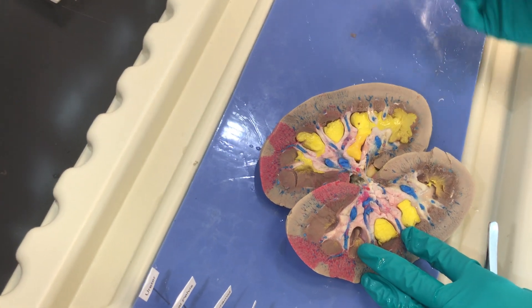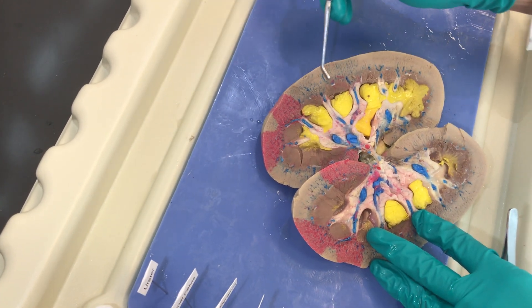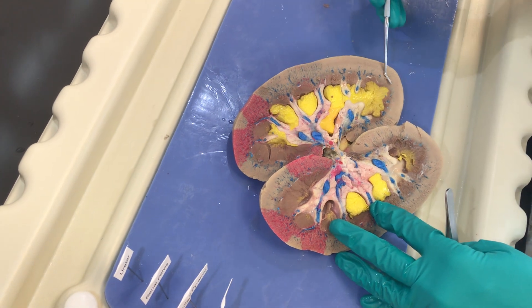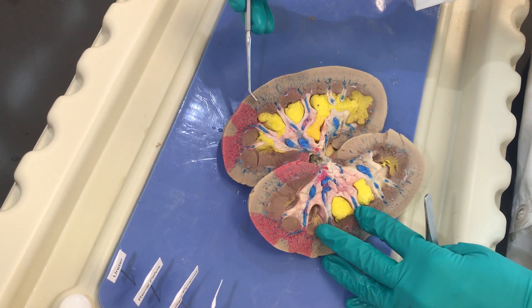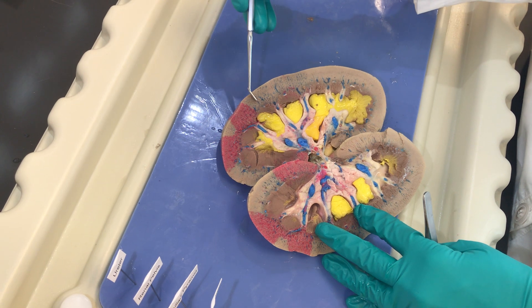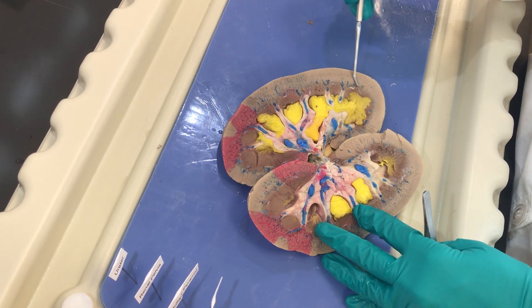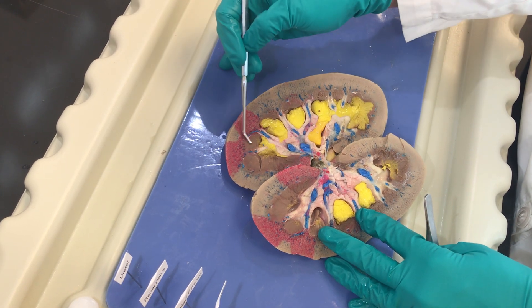Remember the cortex portion of the kidney — this is the outer region; this is where most of our glomeruli are. The proximal convoluted tubule and distal convoluted tubule will also be in the cortical areas.